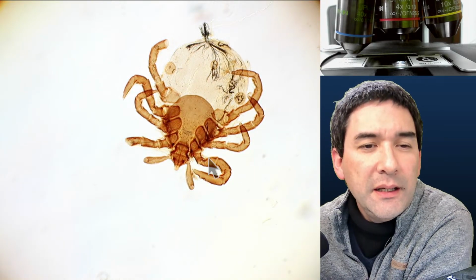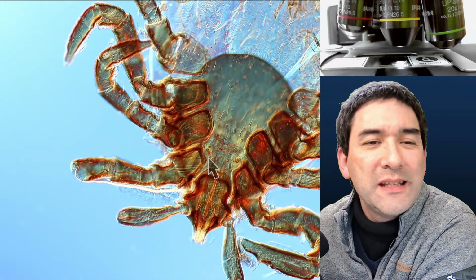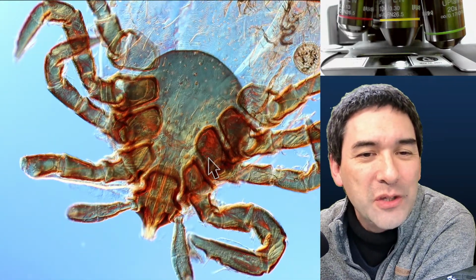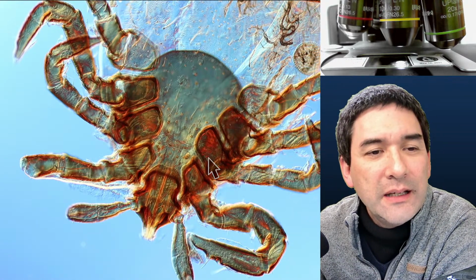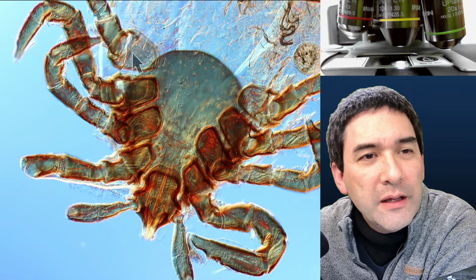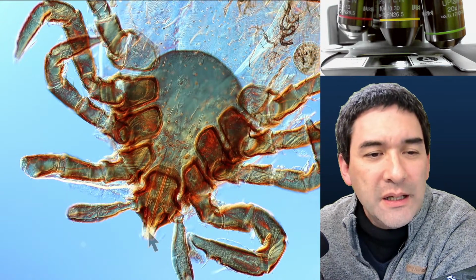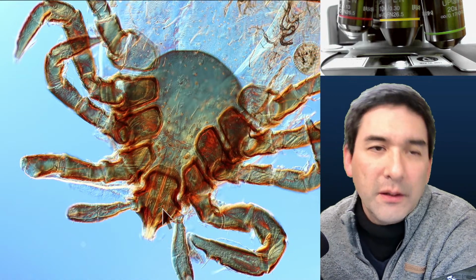So that is a tick. And let's go up again with the magnification a little bit. To a certain extent, I do have to say, it does look a little bit beautiful if you look at it like this. But then again, it's not one that you actually want to be bitten by, right? What we have over here is, you can see this leg is broken off. We've got 1, 2, 3, 4 pairs of legs, and also the proboscis, the little trunk which is used for sucking blood, was broken off here. And another, no wings, as I told you.